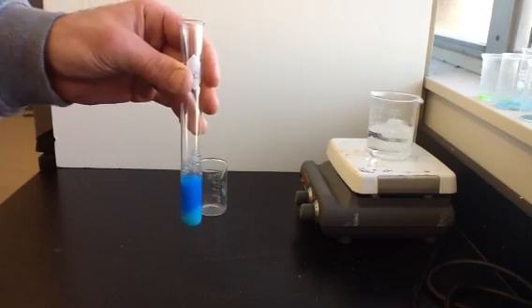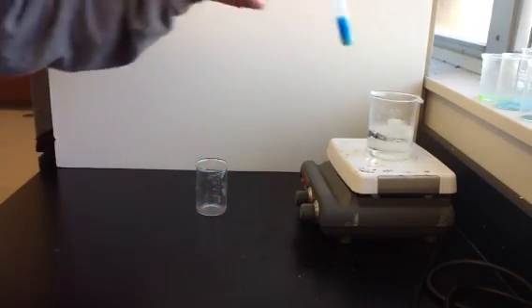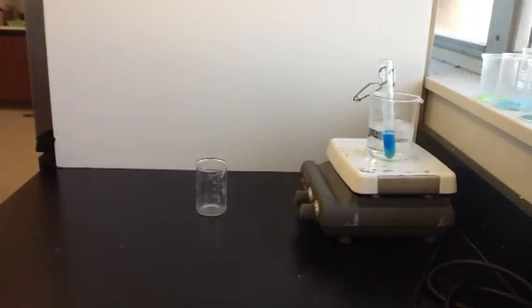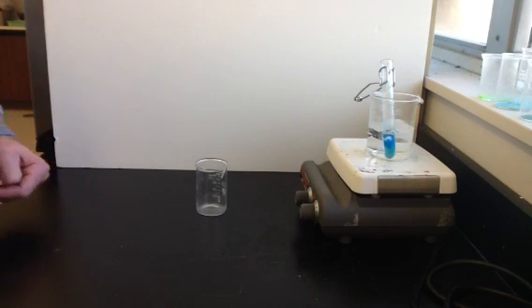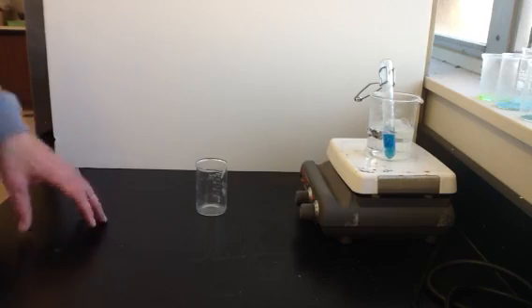Our next step is going to be to heat it. So we're going to take the copper hydroxide and we're going to heat it. Heating the copper hydroxide will change it into copper oxide. So I'll place it into this hot water bath. I'm not going to add any chemicals to it. I'm just going to add heat. And as it heats, we should see a reaction take place. We should see the copper hydroxide changing into copper oxide.